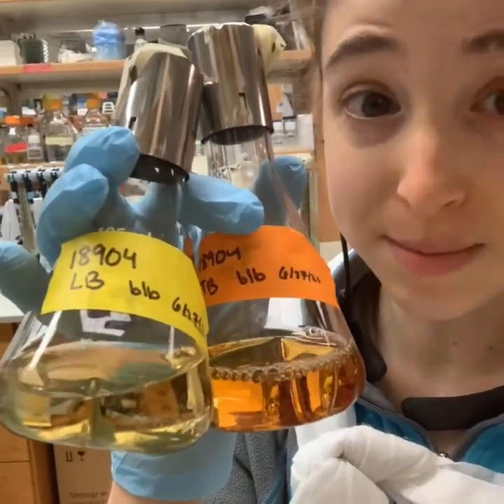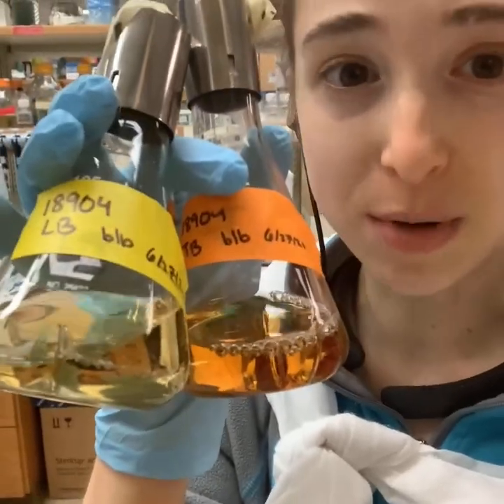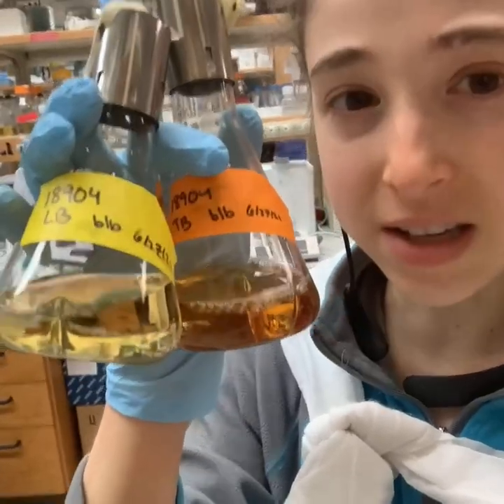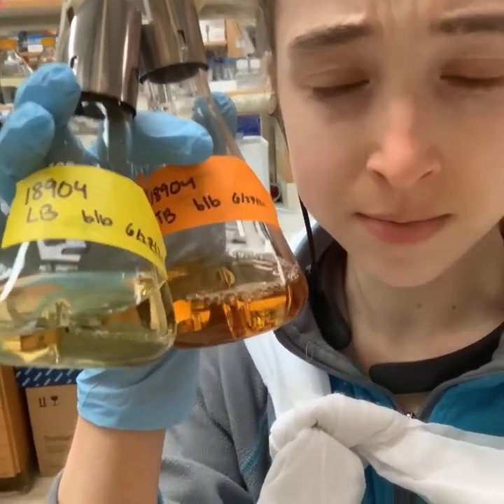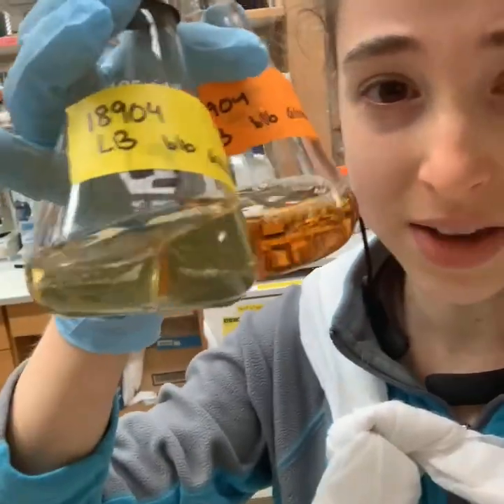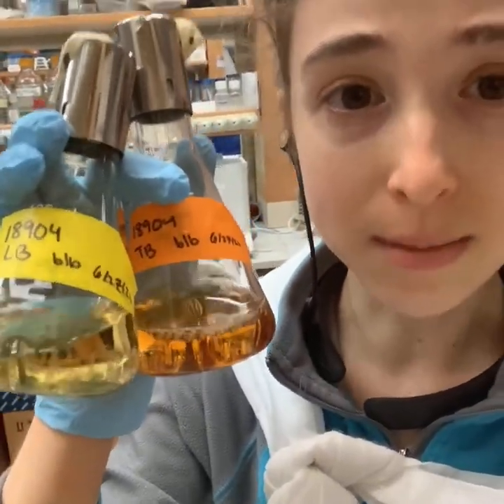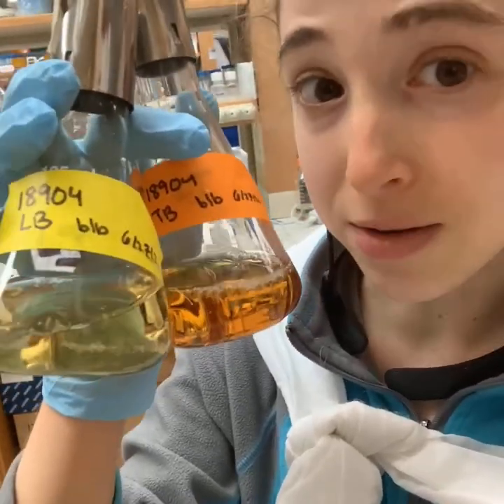There's a protein I want to try to get bacteria to make for me — we call that bacterial expression. I don't know if it's going to work, so I want to give it options. So I'm asking it an important question: TB or not TB? By TB I mean terrific broth, and by not TB I'm giving it the option of LB, lysogeny broth. These are two different bacterial media — different growth food for bacteria.